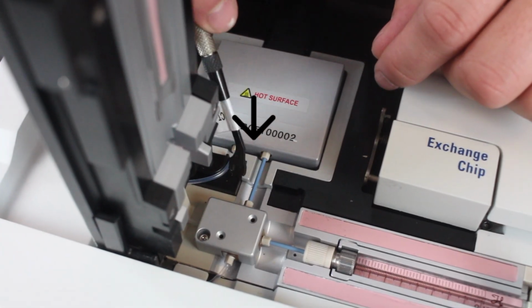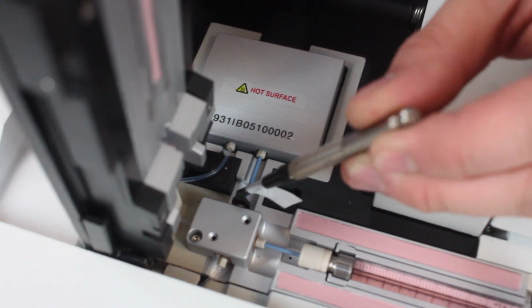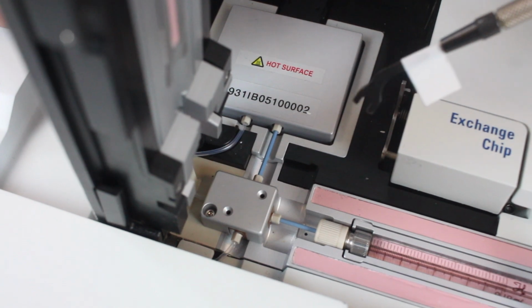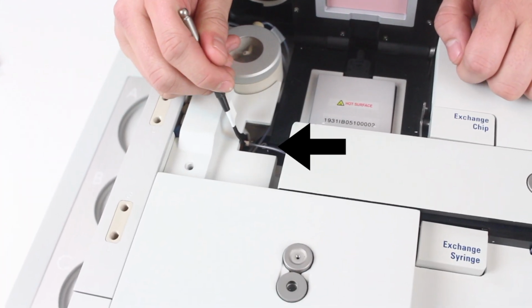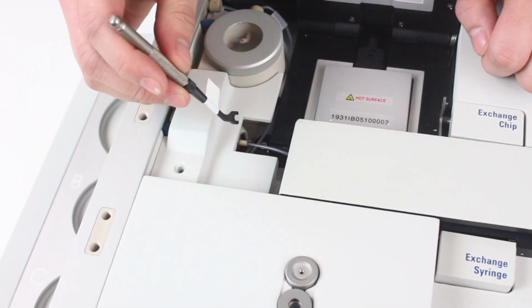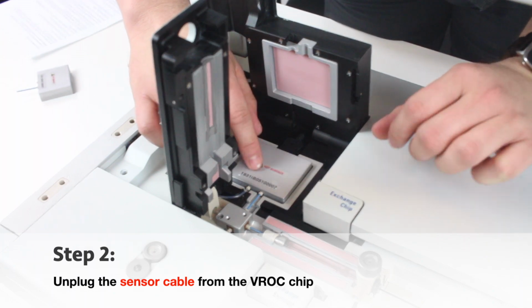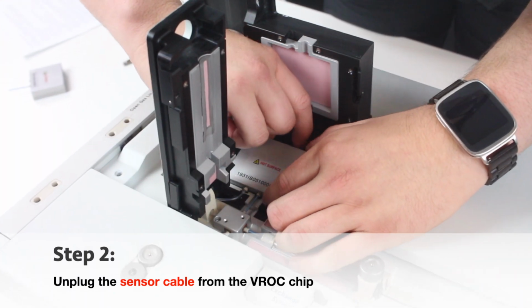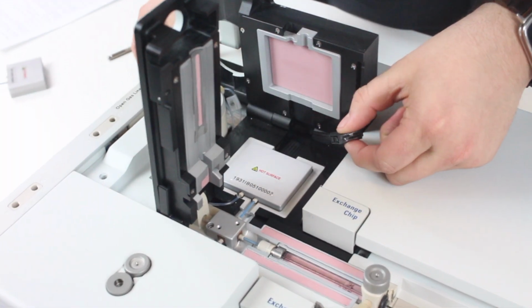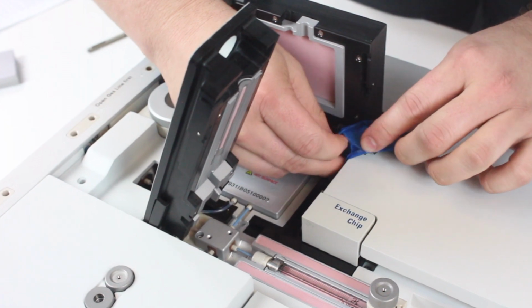The first fitting you're going to need to take out is this one right here, and you're going to do so by just putting the wrench in and turning counterclockwise 5 to 6 times. The second fitting is right here, and again you're going to use your wrench to turn counterclockwise 5 to 6 times. Finally, you're going to need to take off the sensor cable from the chip. Just be careful to not drop it down into the machine. I recommend taking a piece of tape and taping it down so it doesn't get lost.